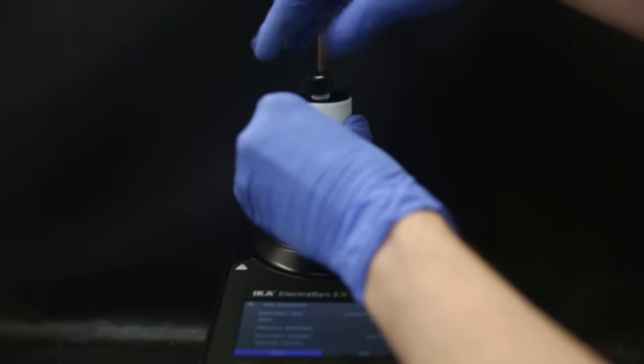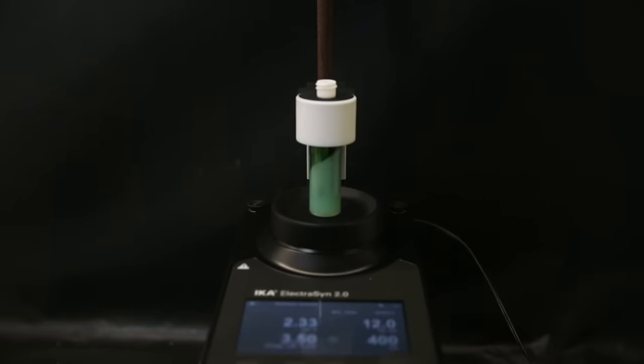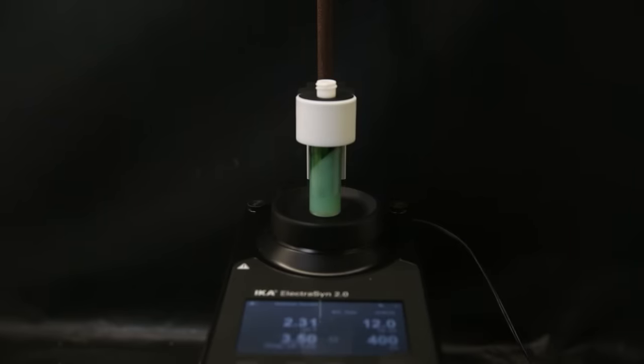It magnetically attaches to the pins in the back, and I press start. It then starts stirring and supplying current. It tells you how much time it takes for it to supply the 3.5 faraday per mole, and for this amount it's about 12 hours, so I just leave it to react overnight.